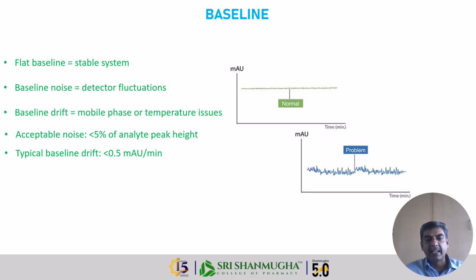Okay, why is the baseline getting noisier? Because of the detector's fluctuation. Why is the baseline getting drifted? It is due to a change in or incompatibility of the mobile phase, or temperature issues. What is baseline drift? Drift means the baseline moves from the lower part of the chromatogram to the top part. That is like either climbing a hill or coming down a hill. So the baseline will appear like that, like an aeroplane taking off. So baseline drift is caused by the mobile phase or temperature issues.